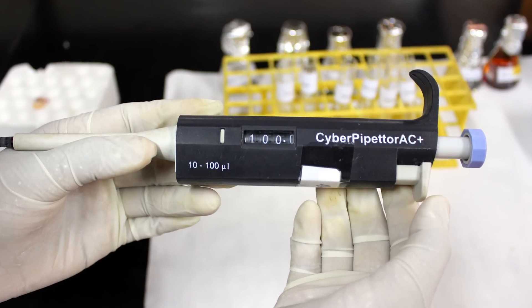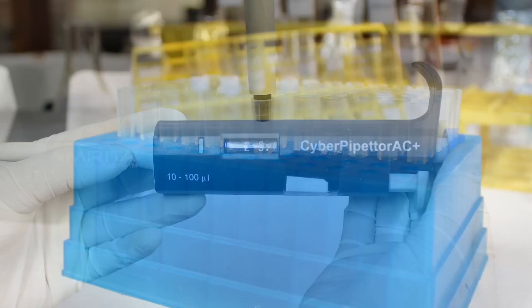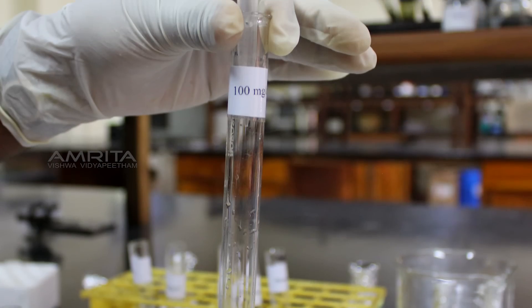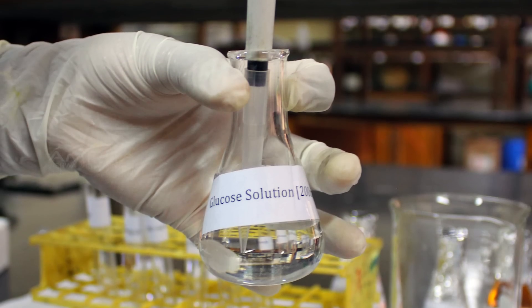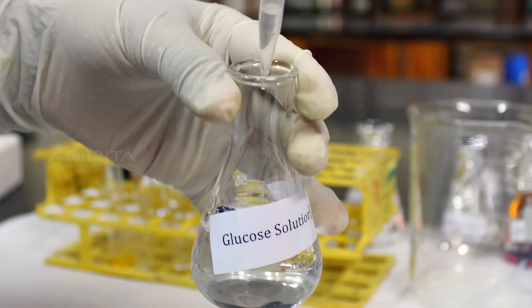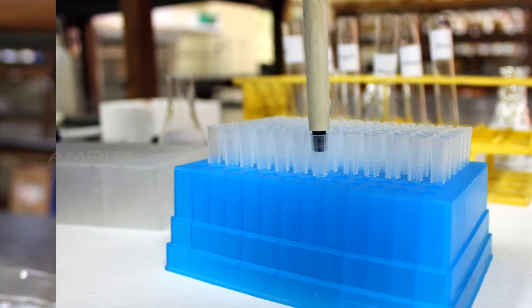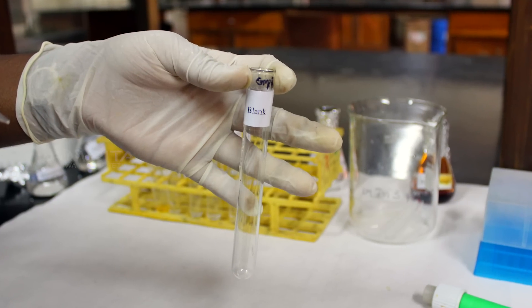Next, transfer 125 microliters of glucose standard solution to a test tube labelled as 50 mg per deciliter. Similarly, transfer 250 microliters of glucose standard solution to the second test tube labelled as 100 mg per deciliter, 375 microliters to the third test tube labelled as 150 mg per deciliter, and 500 microliters to the fourth test tube labelled as 200 mg per deciliter. Now insert a fresh tip to the micropipette and transfer 500 microliters of distilled water to a test tube labelled as blank.